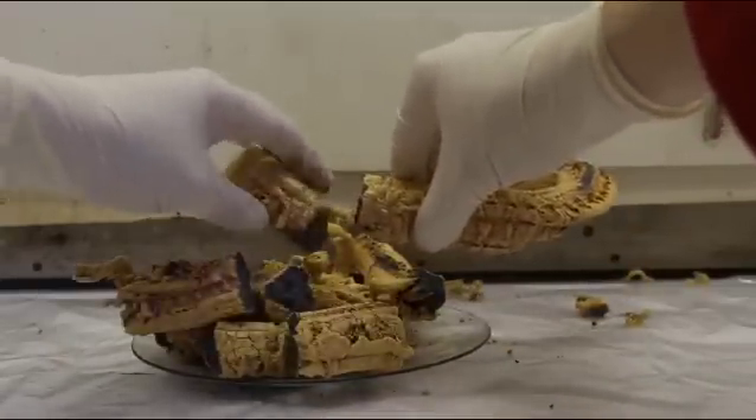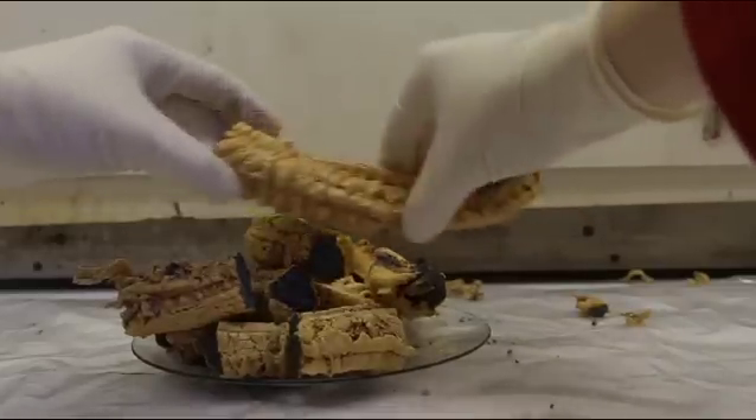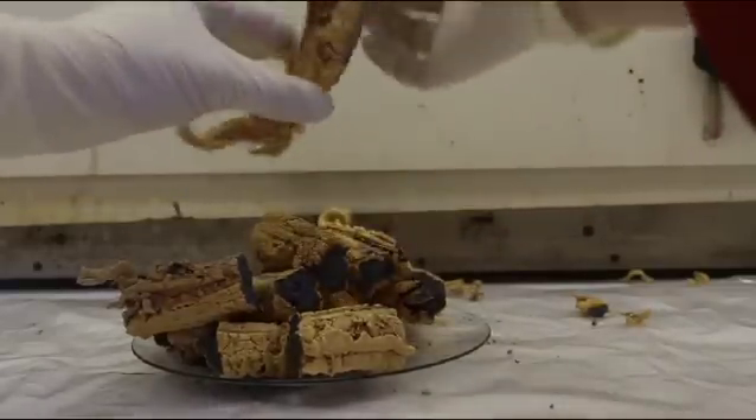The snake is highly contaminated with mercury, so clean up any piece that you can find and place all of the bits in an appropriate mercury waste container.